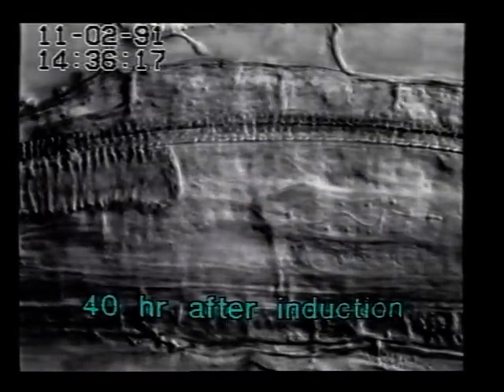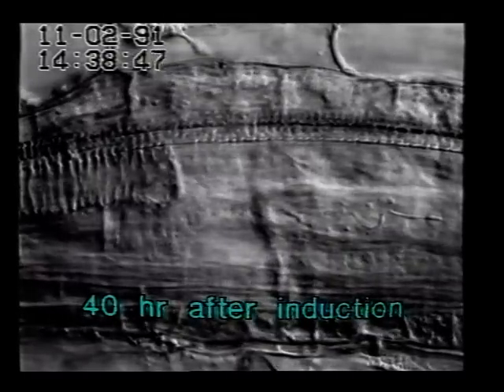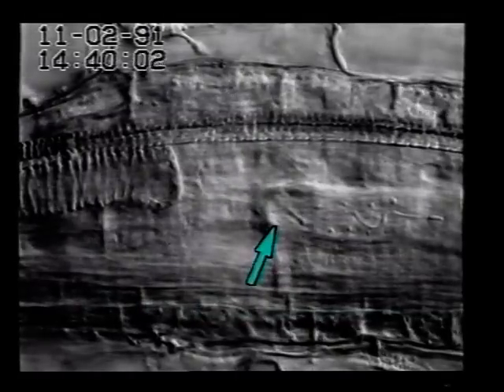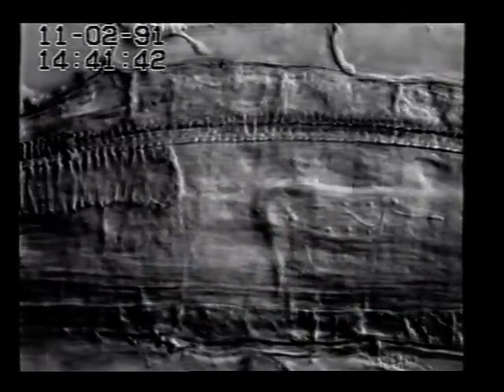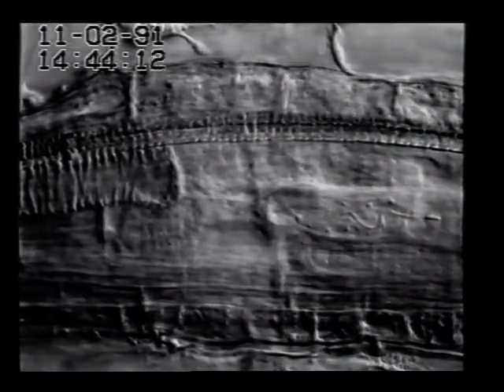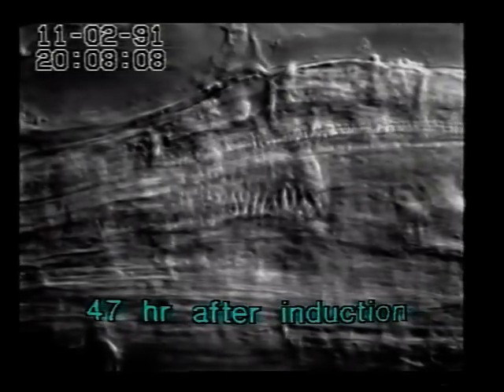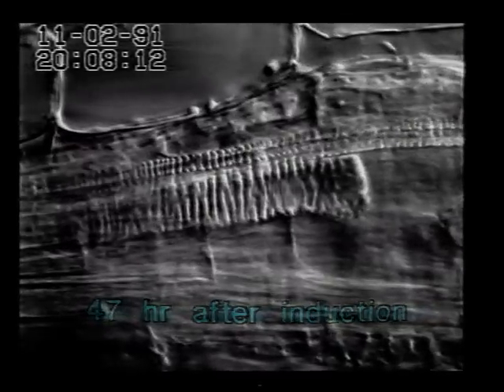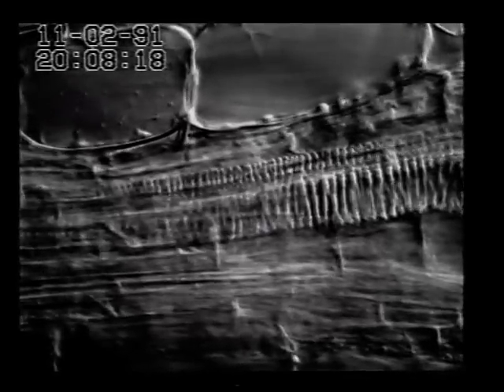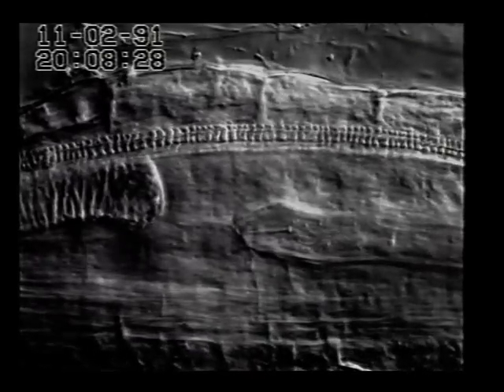About 40 hours after the induction, the central cylinder is clearly widened. The head end of the nematode is surrounded by several giant cells. These cells are pierced with the stylet and after a certain time of stylet protrusion, the median bulb starts to pulsate for food withdrawal. The system of giant cells, shown about 47 hours after induction, reveals multi-nucleate cells surrounding the nematode that are extensively hypertrophied. Their development has suppressed the differentiation of xylem elements. Already differentiated elements project into the giant cell system without being connected to others, which will obviously greatly reduce water transport.